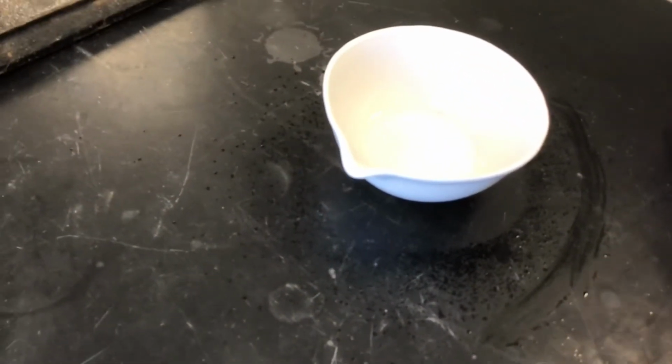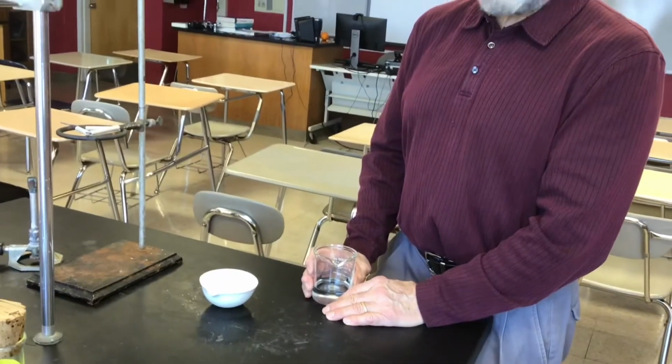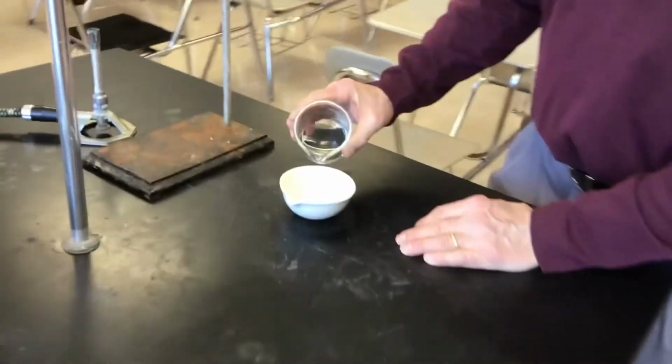Look at this, Mr. Moore. You see we got a halo. Should I put the watch glass over it? Okay, after consulting on whether we should redo this or not, we're just going to stay with it. We're going to forge ahead here.